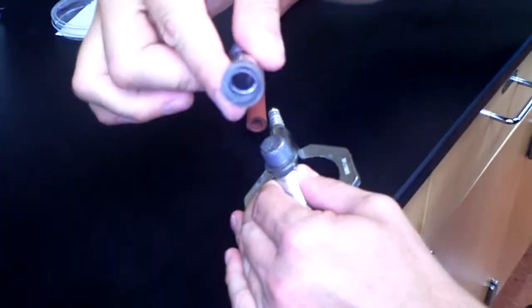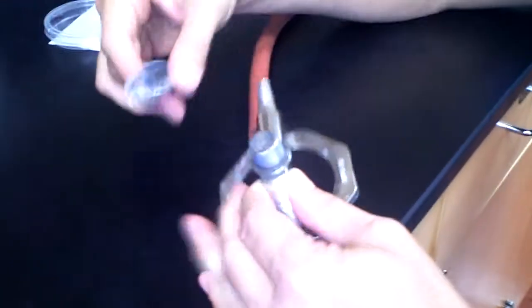If you look down the barrel, you can see that it's hollow. The barrel screws on to the base.